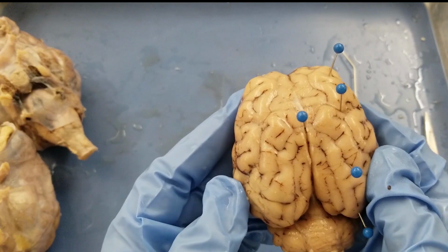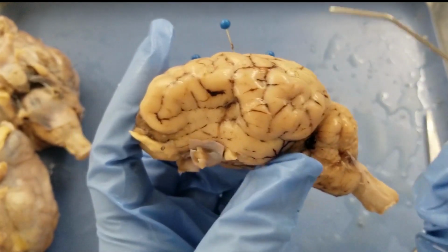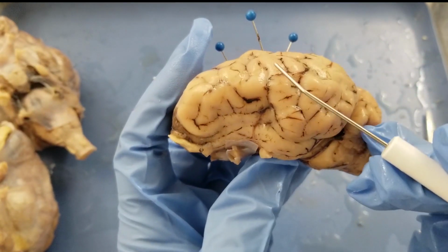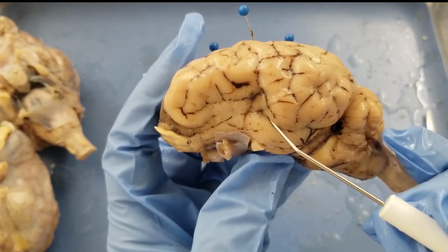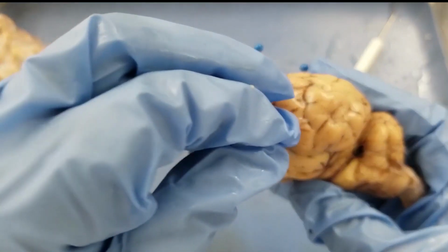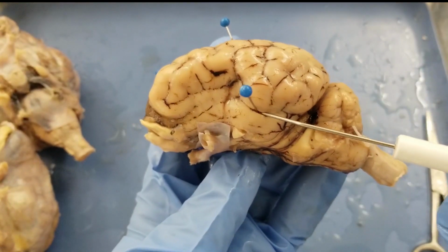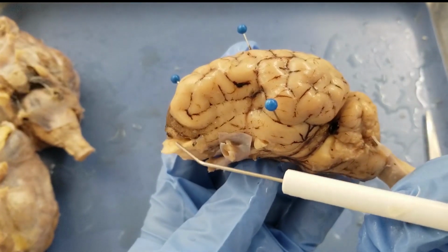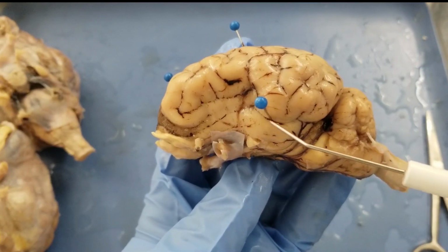Okay, then the last one is the rhinal sulcus for this step. So the rhinal sulcus is something in here. The first one is a sulcus, right? Second, it is in the temporal lobe. So this is the rhinal sulcus. You see there's a dent here. That's the rhinal sulcus. And why is it called the rhinal sulcus? Rhinal means nose, right? Because that stores a lot of information from smell. So a lot of nerves from the olfactory bulb go along here and then end here. So that is the smell center.